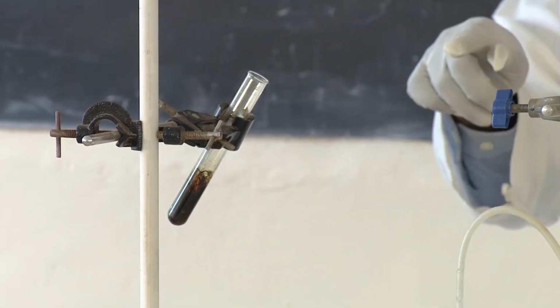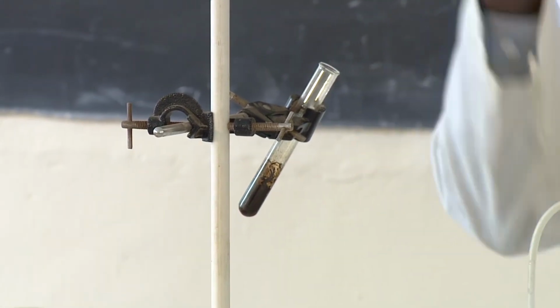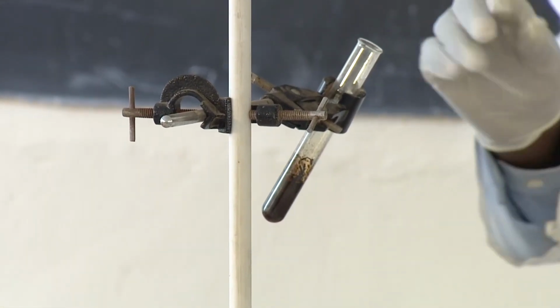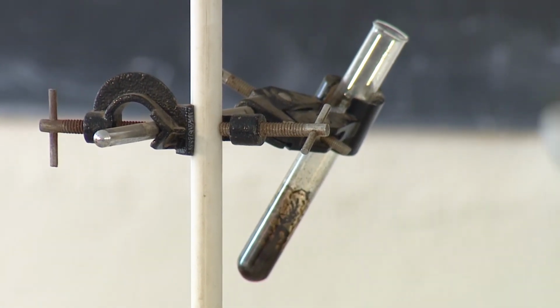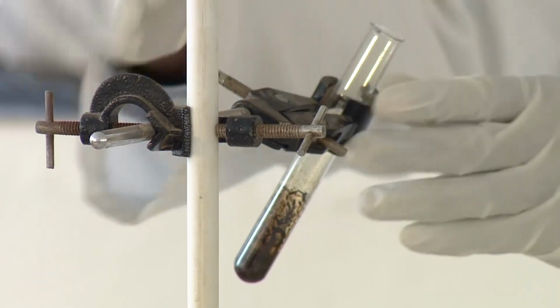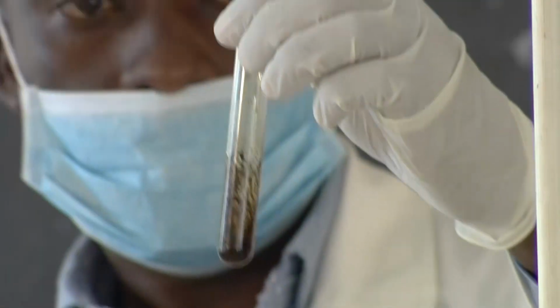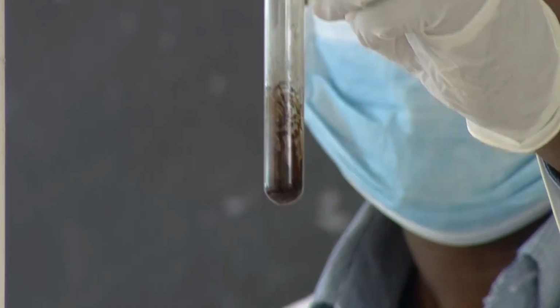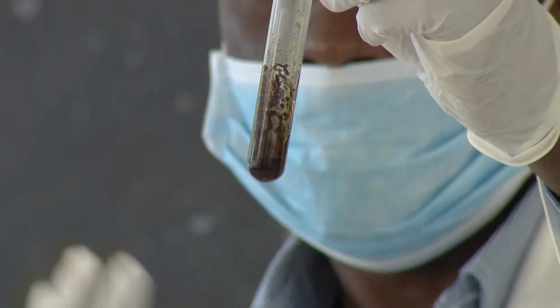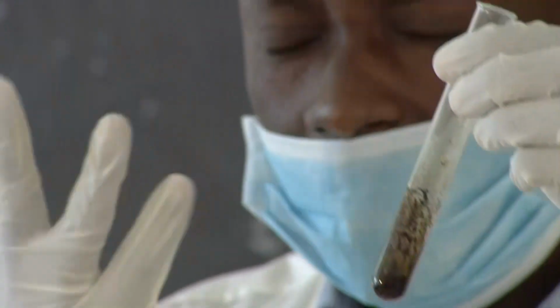So if you are very observant, just take a look. I said I don't want to prepare a lot of it. There is some yellowish color that is seen. Some small greenish color and yellow is also coming there. Very little of it, it is there. So that is the color of the chlorine gas, yellowish green. The color is in between.